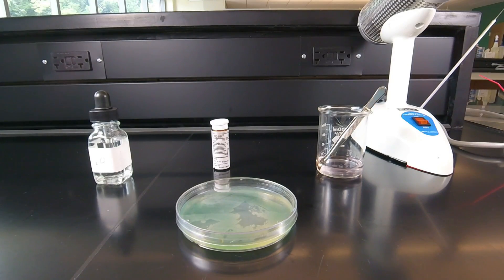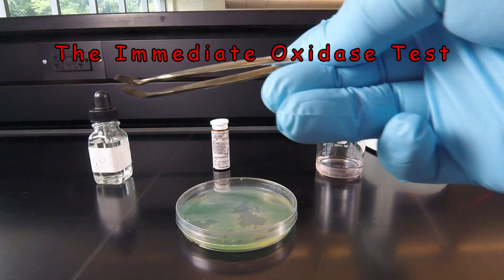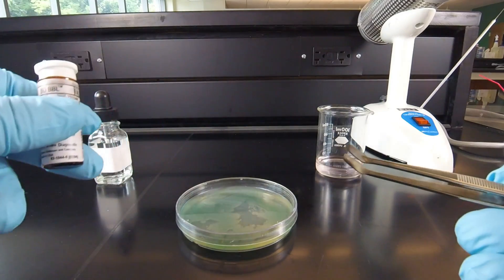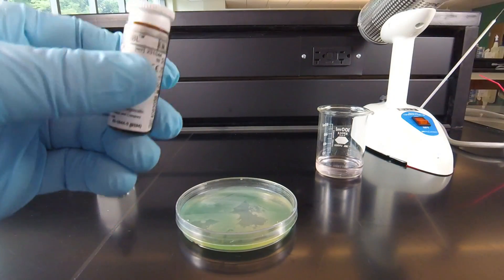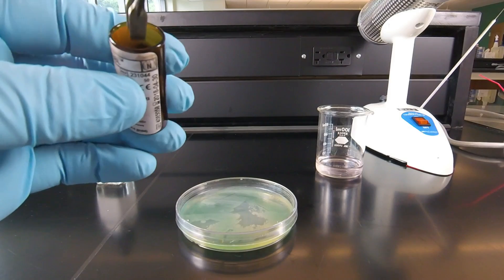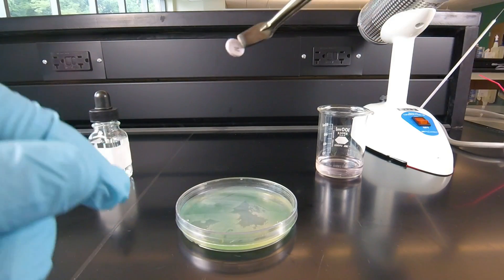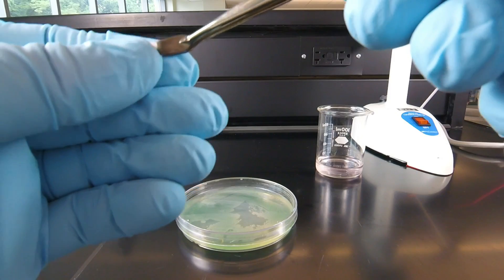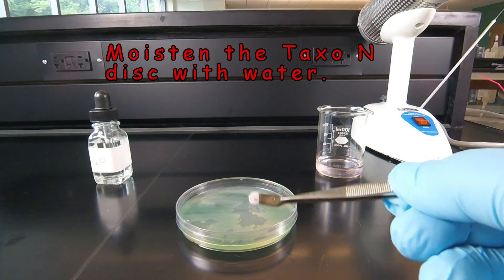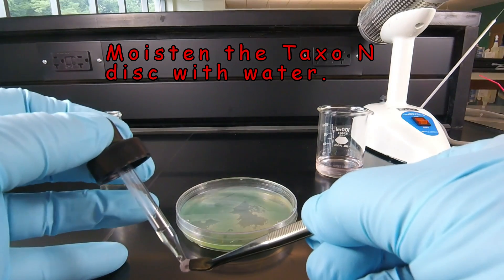To perform the oxidase test, we place some forceps in alcohol, catch the alcohol on fire with a lighter, and let the alcohol burn off. We then use that to remove a Taxo N or oxidase disc from the vial. We don't have to keep the disc sterile, but we don't want to contaminate the discs, so we try to get a disc out carefully. We then moisten the disc with a drop or two of distilled water to activate it.